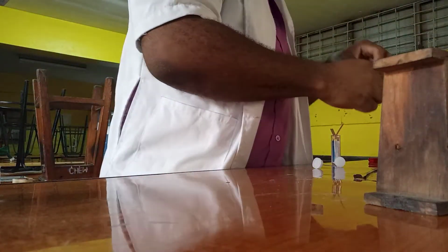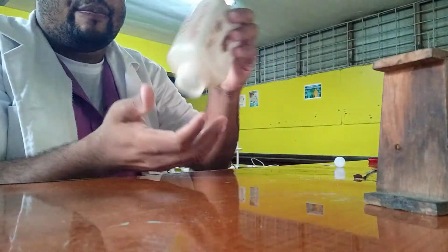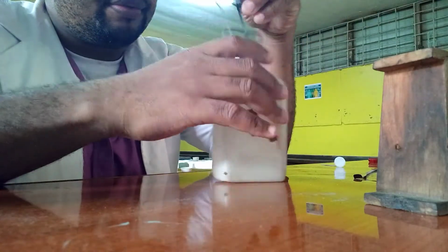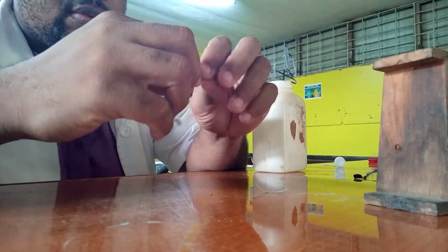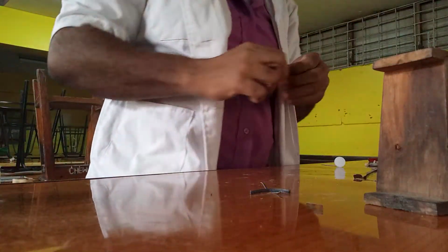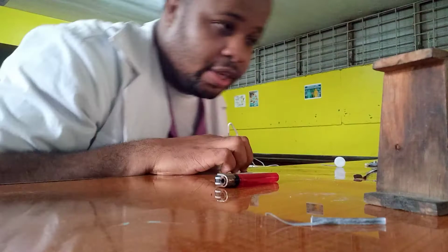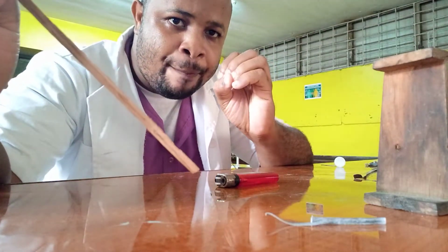So with that out of the way, we are going to do some reactions now of the acid. So we know that acids react with metals to form salt and hydrogen gas. So here I have magnesium ribbon. So metals react with acid to form salt and hydrogen gas. Now if it's hydrogen gas that is being produced, when we light this splint, if we place it inside the test tube, you should hear a pop sound and it goes out.